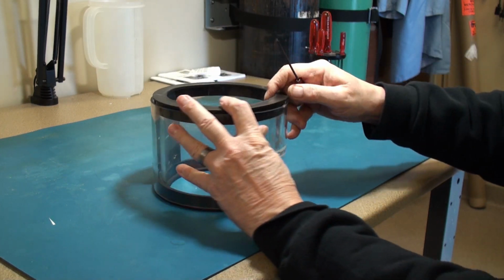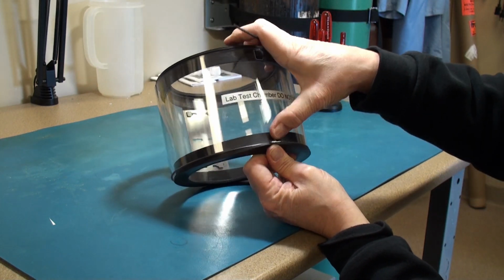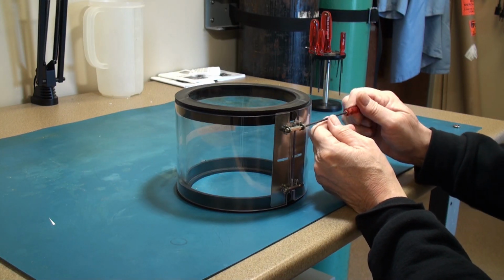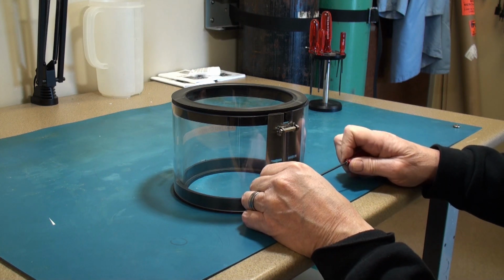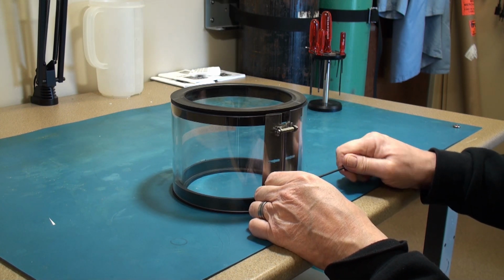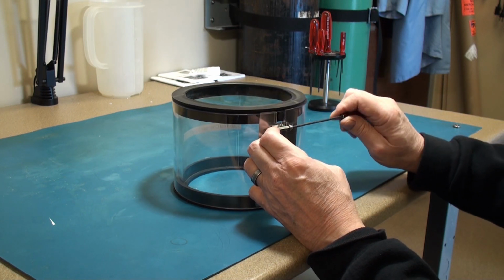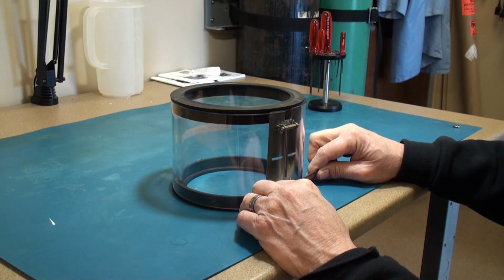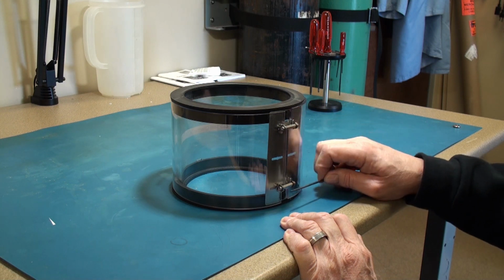Make sure that the O-rings and the L gaskets all line up on the opposite side and everything fits in there nicely, before you tighten things down. Now this will allow you to tighten these hex screws down till they're snug. On the 300 size bell jar, these may not snug up all the way. Just make sure that they're in place and they're snug. They're not necessarily tightened down to the end of the travel of the screw.